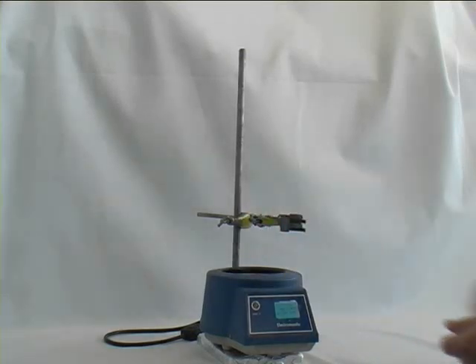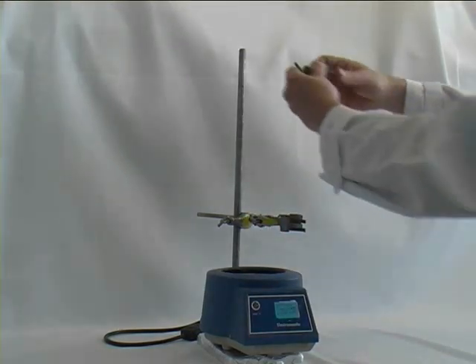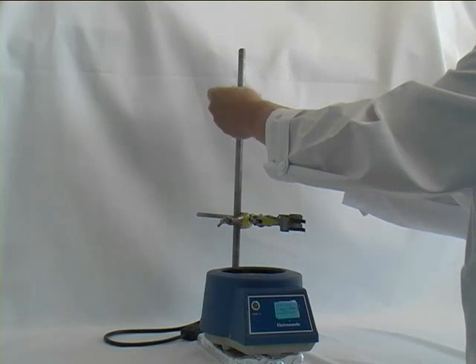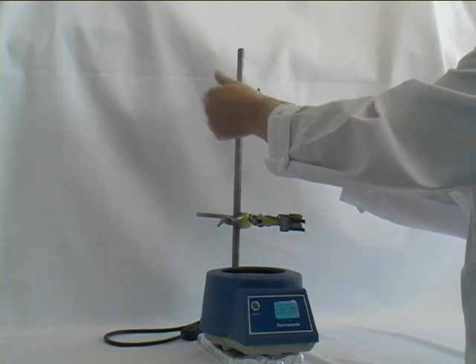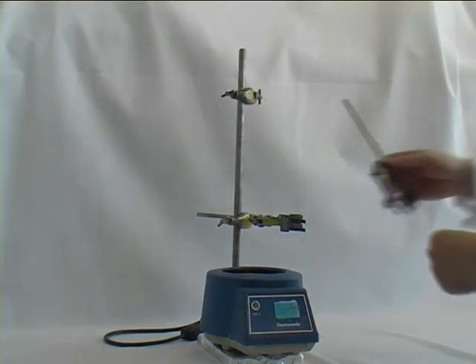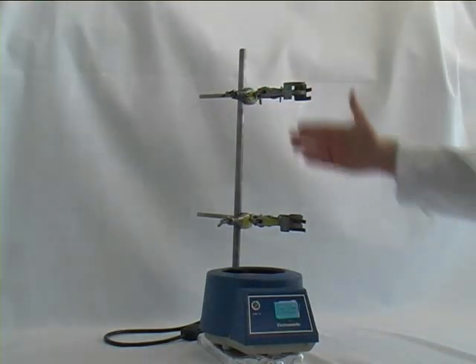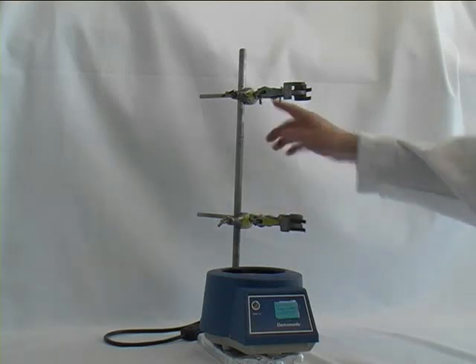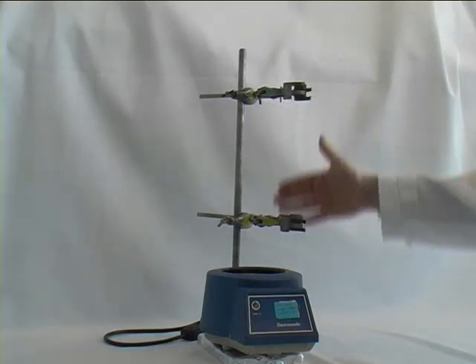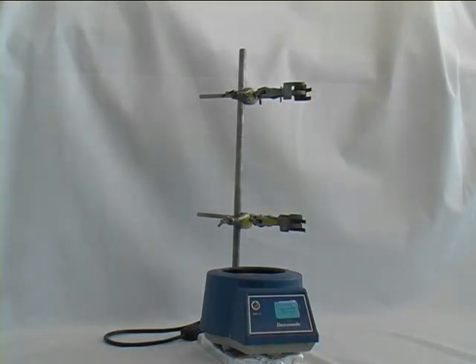Please make sure that the openings of the bosses point upwards. In this way, it is very easy to align the apparatus later on. As you will see later on, it is quite important to align the apparatus vertically, because then it is easier to finally assemble it in the end.